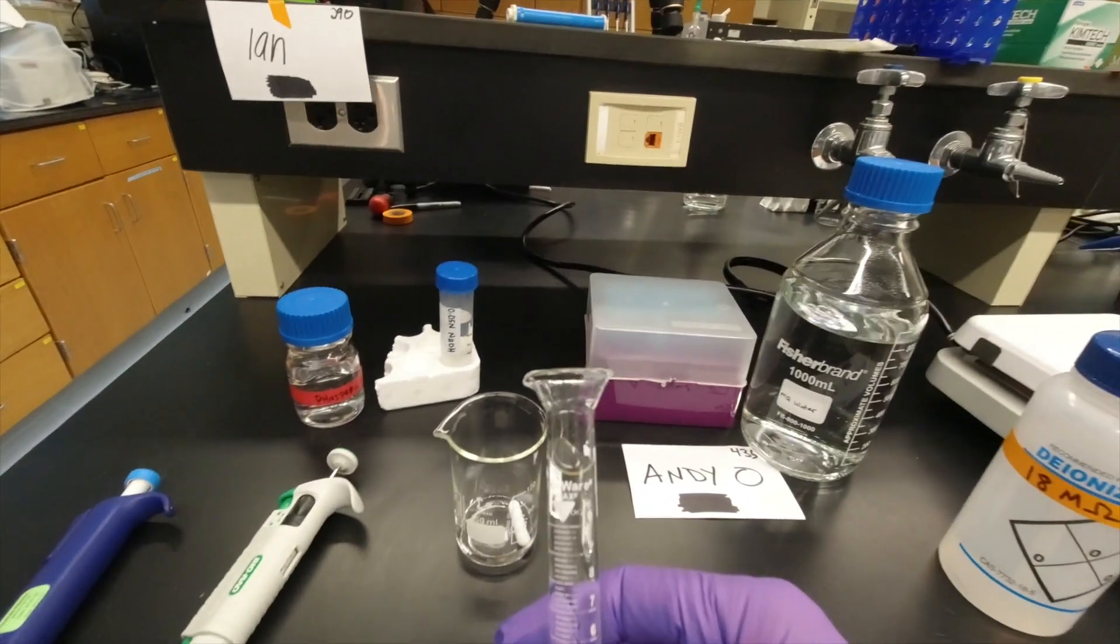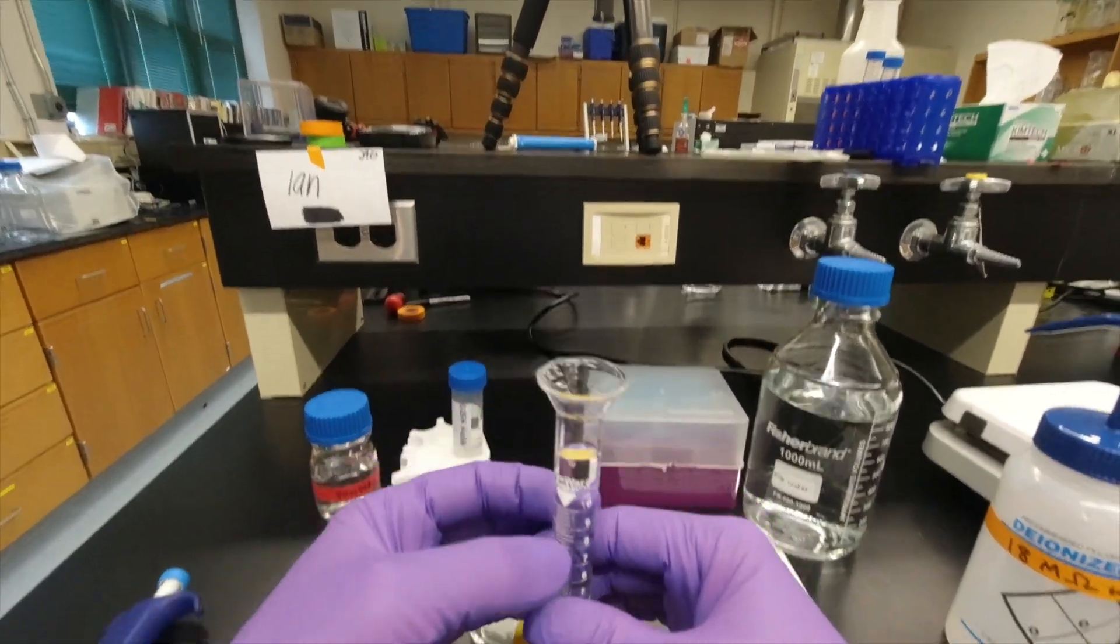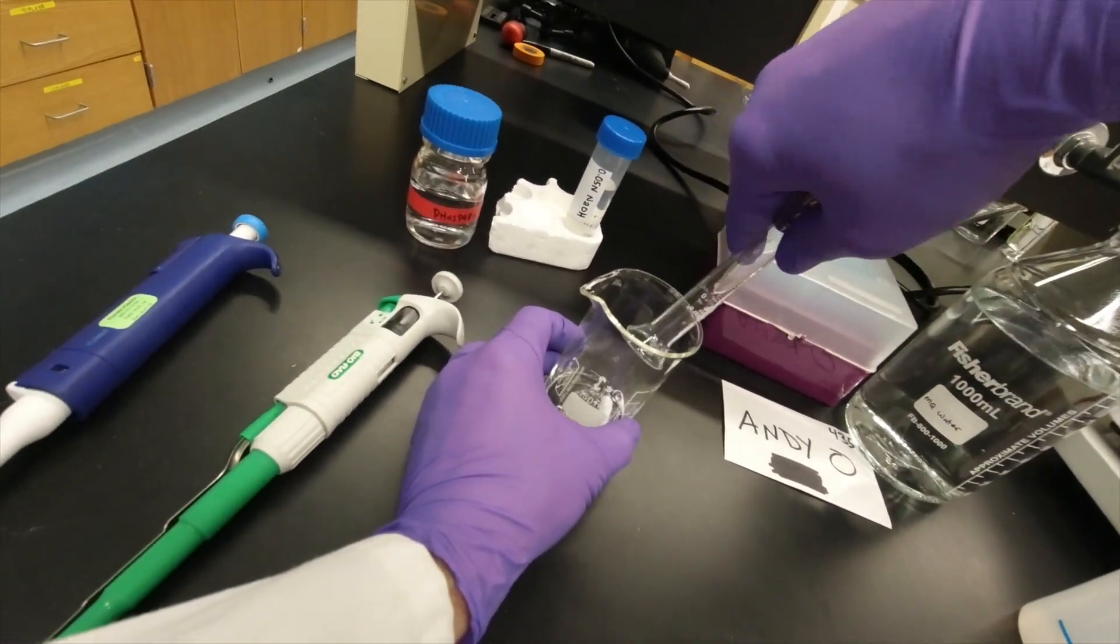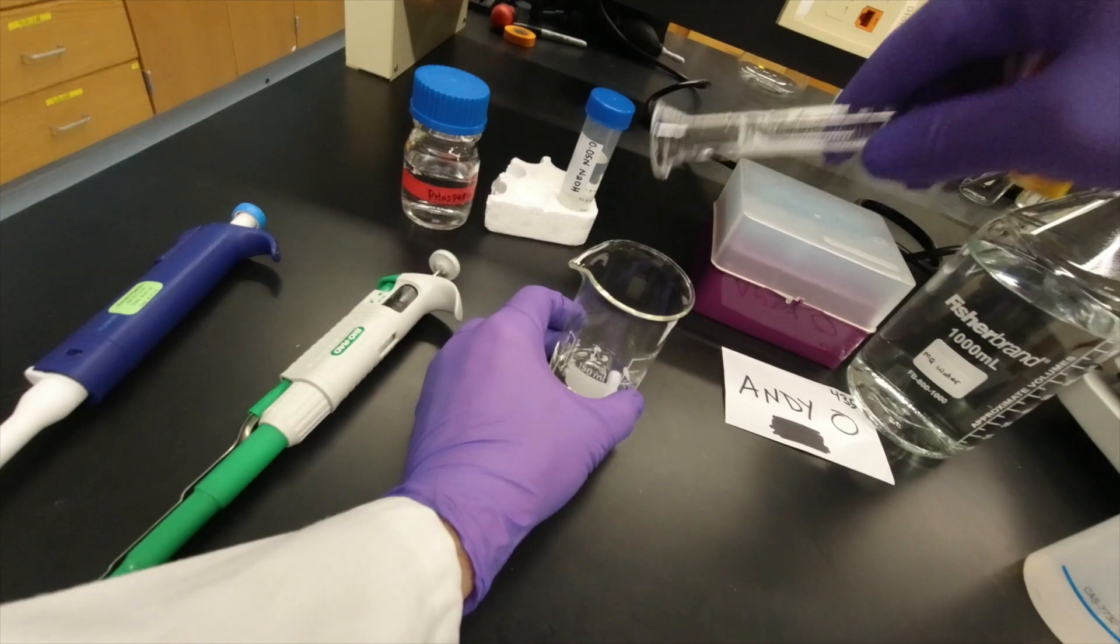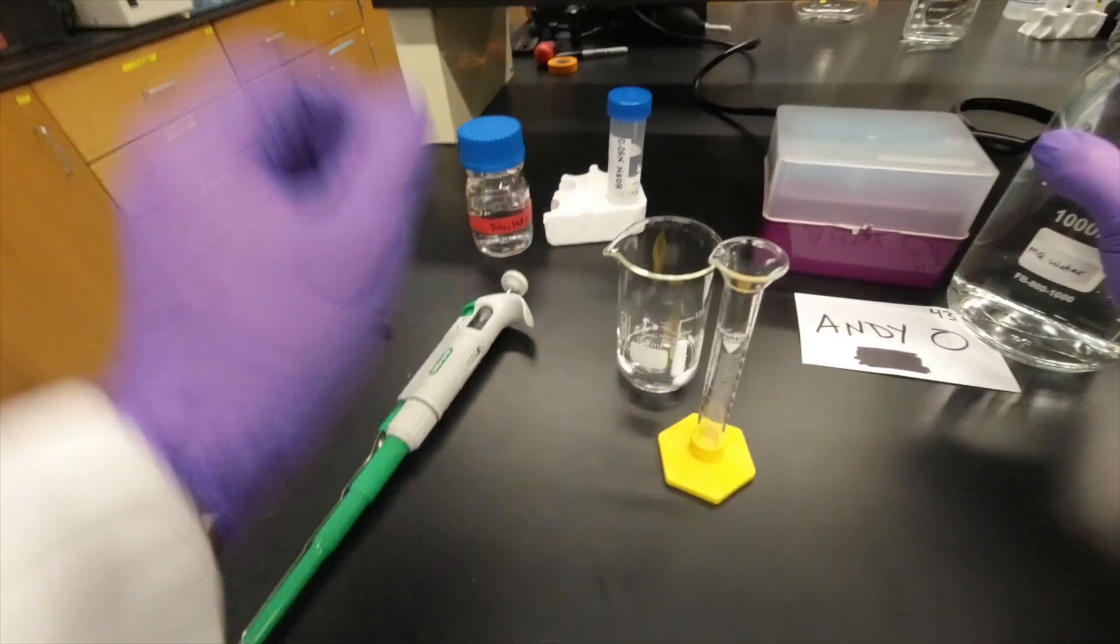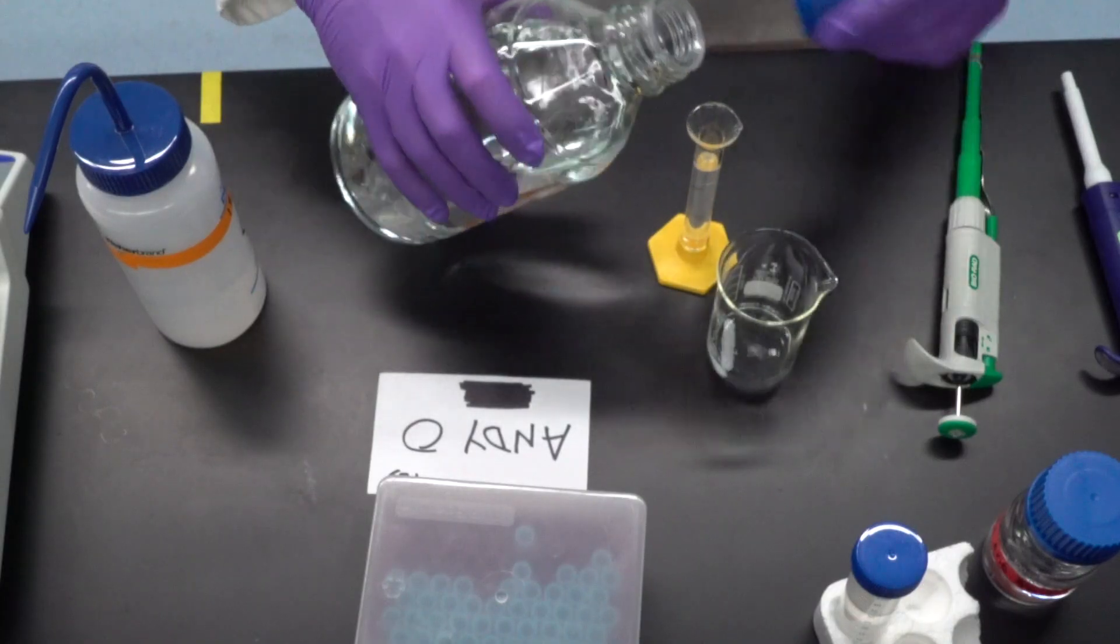Let's estimate that. Maybe 12 milliliters, but that doesn't matter. 22. Get it all in there. So what you're doing is you're rinsing the whole thing out.